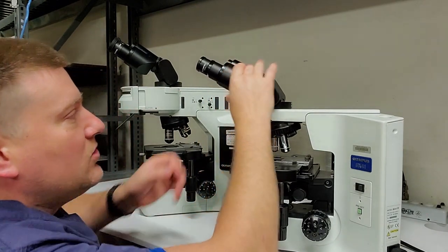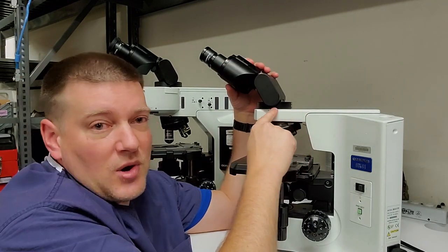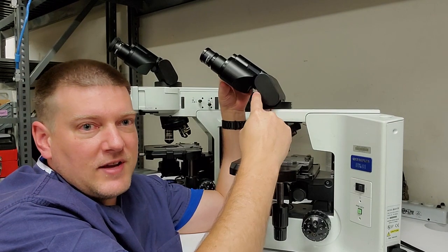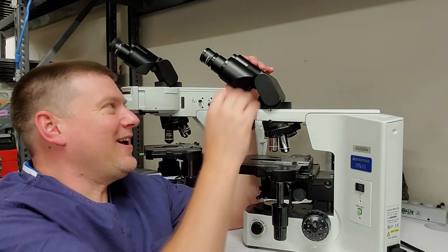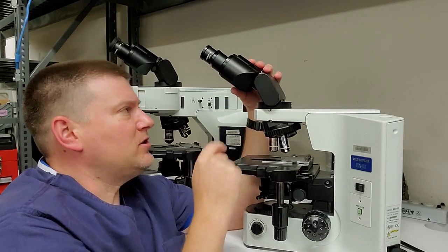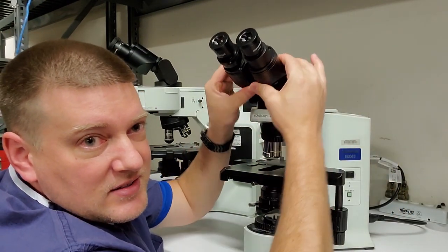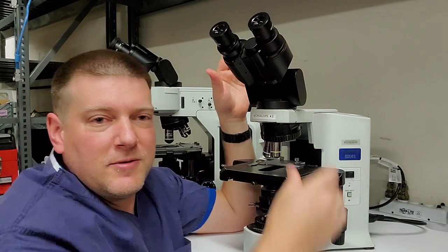The oculars slide into something called a binocular. Go figure, right? Now, binoculars are almost always removable from microscopes. You can see I have a little set screw right here for this one. Now, this here is a flexible binocular. You can see how it's flexing here. Some of them are stationary, which obviously these ones are way too expensive to have stationary. But binoculars like this one, see how it can rotate side to side? That's a very unusual feature. But what they almost always have is something called an IPD, which is an interpupillary distance. See that? And that is the distance between your eyes, because human faces are all different.